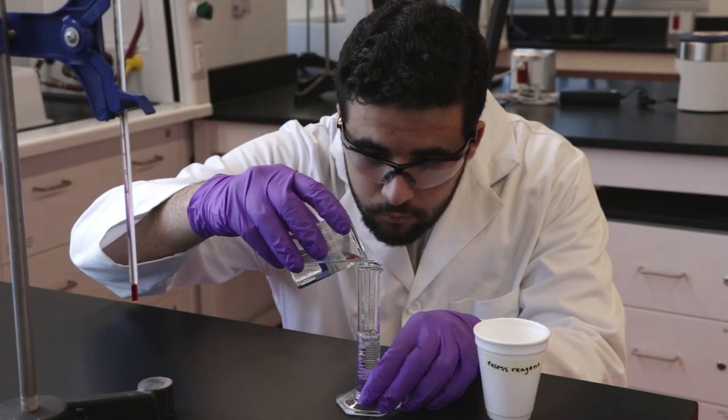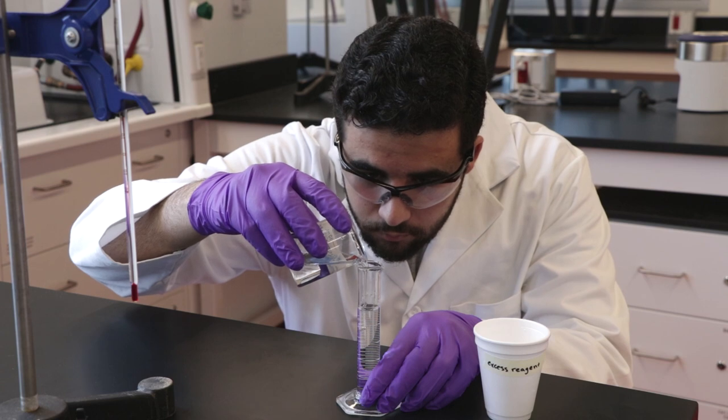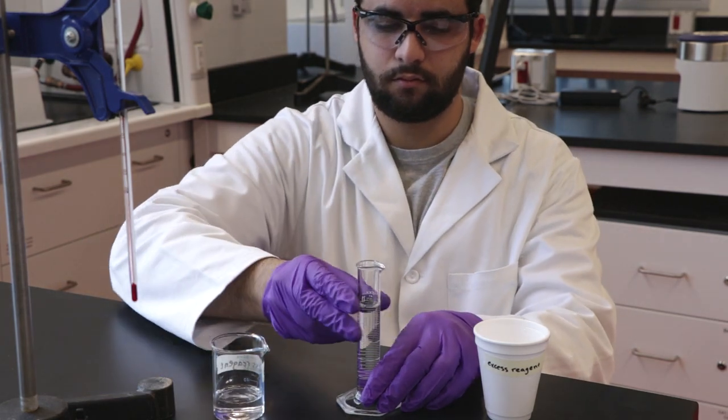Using a graduated cylinder, transfer 50 mL of the excess reagent into the styrofoam cup.